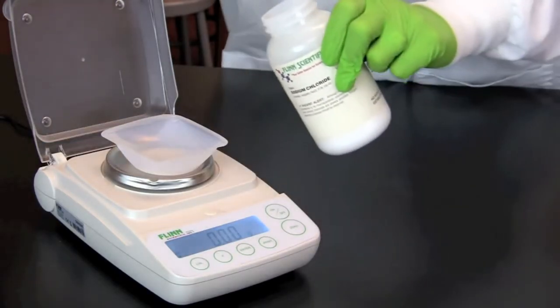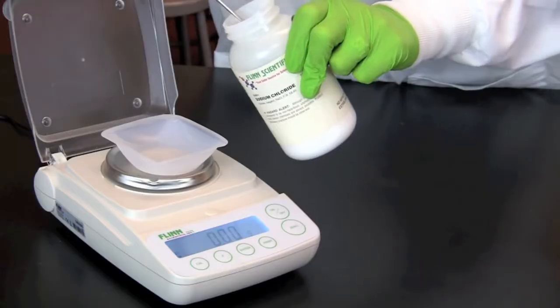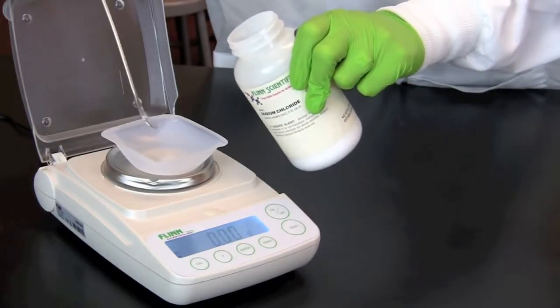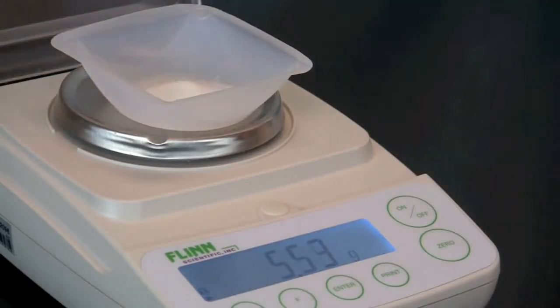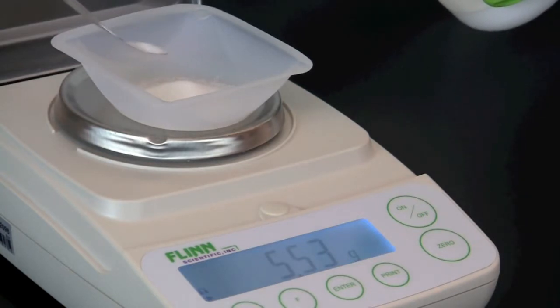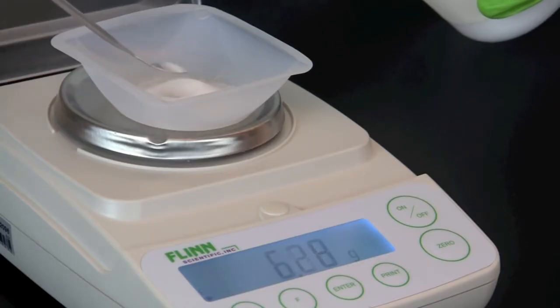Using a spatula, slowly add the material that you are weighing into the weigh boat. Continue to add material until you reach the amount of material that you want.